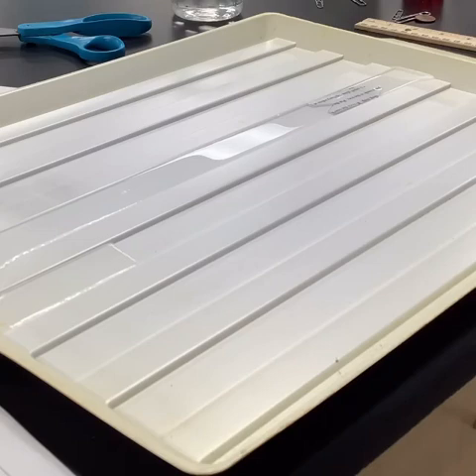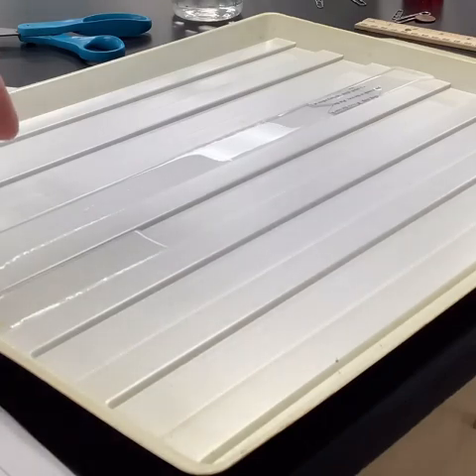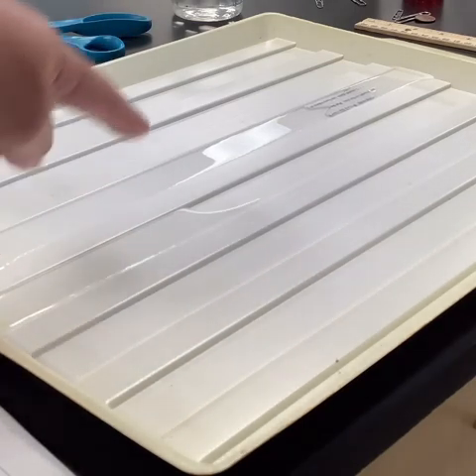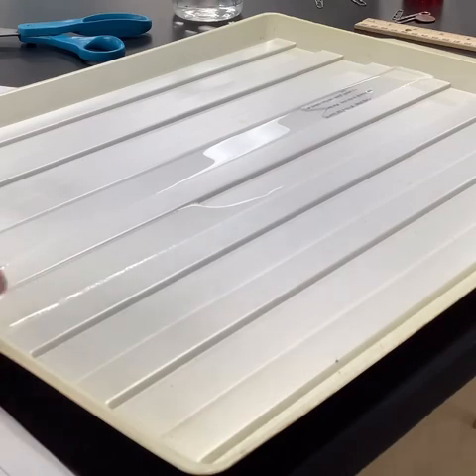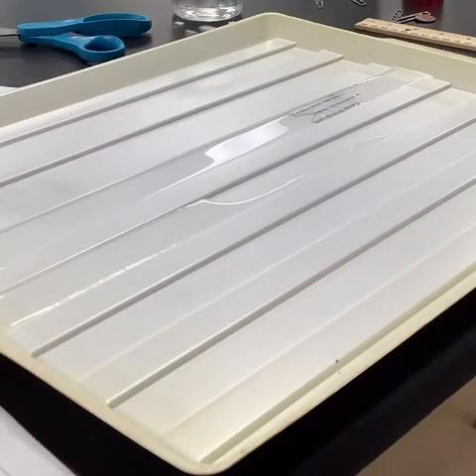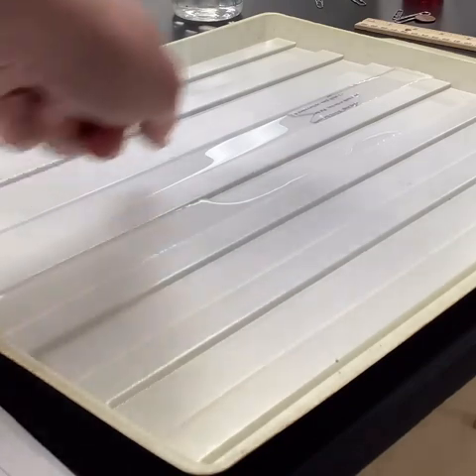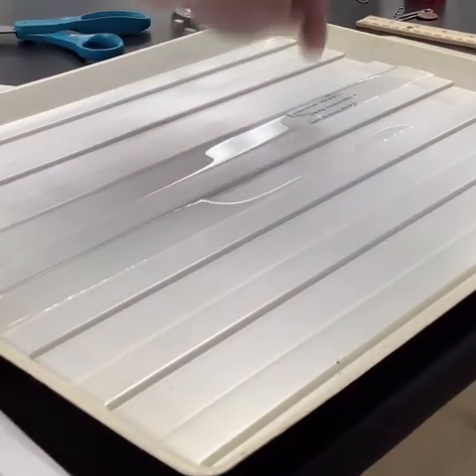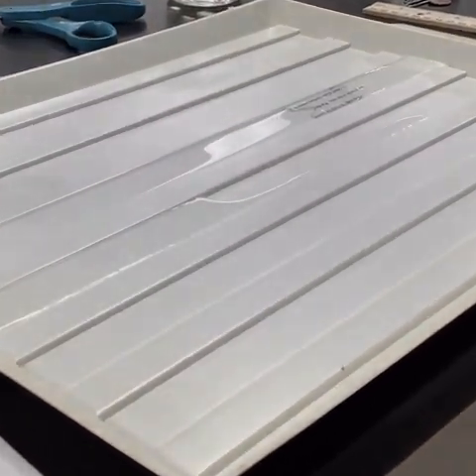So we're going to try and explain why, when I put one drop in that little notch, that thing took off, right? You'll also notice what's happening over here. The water that was in that groove is starting to spill over. And that happened after I put, what, 3 or 4 or 5 drops in? Doesn't seem like it should be enough to fill up that entire groove, and that's related. So we want to think about what that one drop was doing when it fell in that notch that would send the boat racing down the channel.